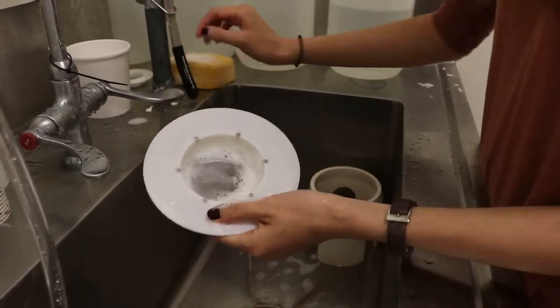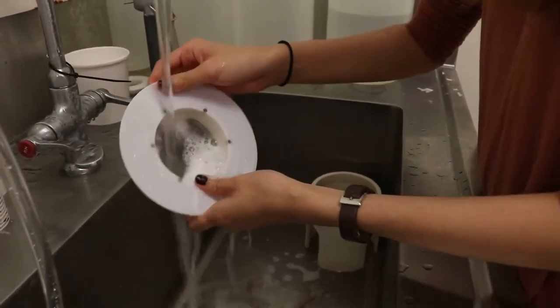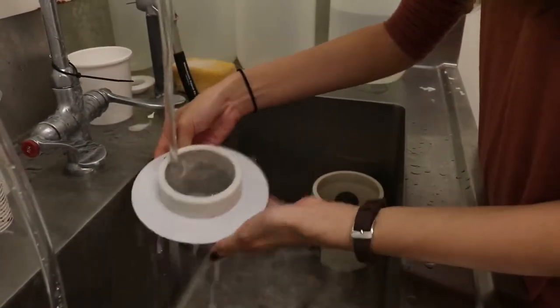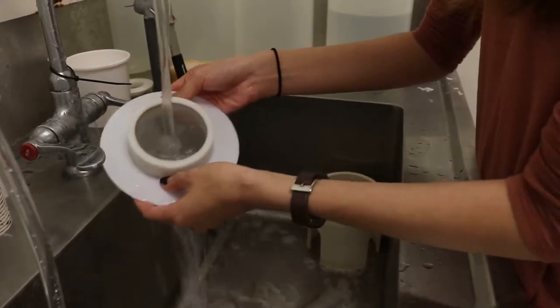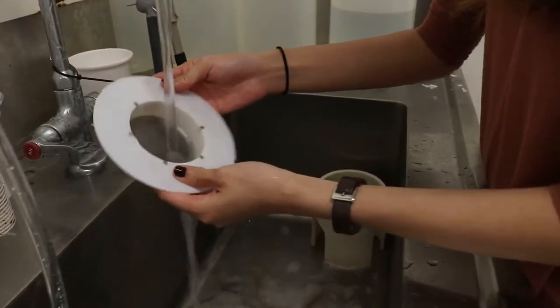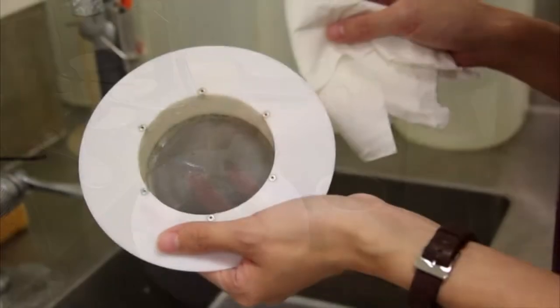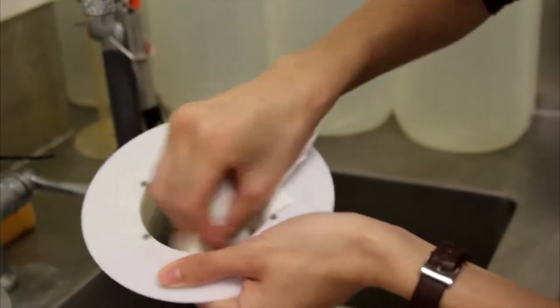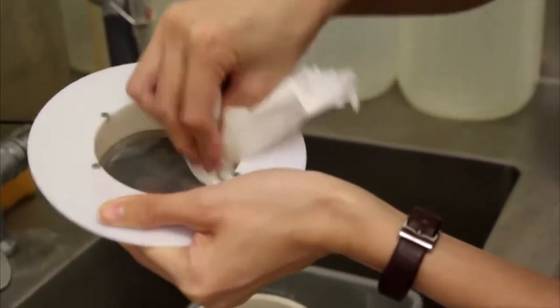Clean the strainer with soap and hot water. Wipe the strainer with a paper towel to prevent cross-contamination between colonies.